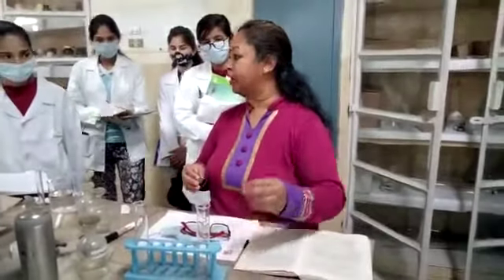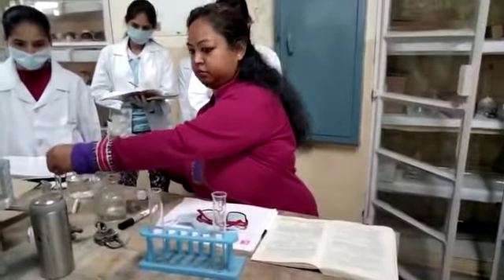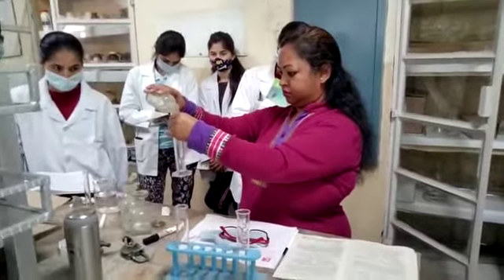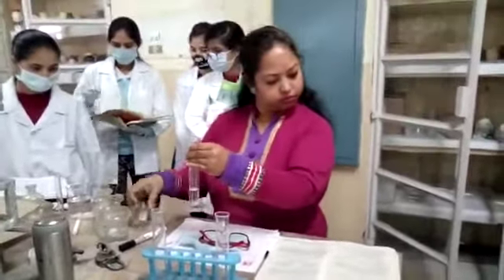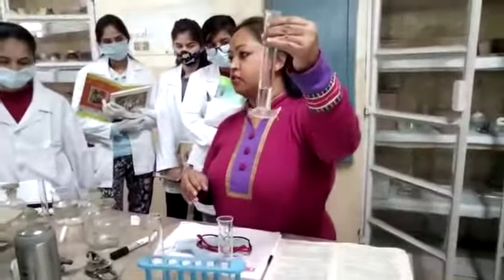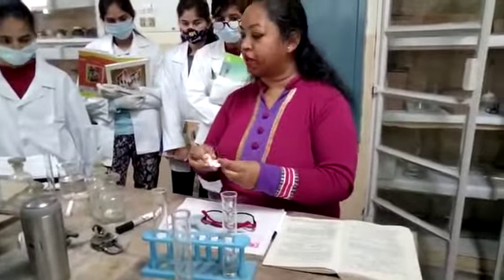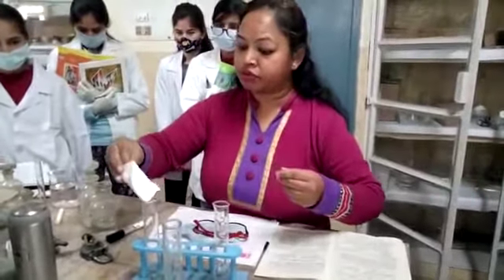In the standard cylinder, we will add 15 ml sulfate standard solution. This is the sulfate standard solution and I am adding that in the standard Nessler cylinder. We have a sample of sodium bicarbonate in which we have to test the impurities of sulfates.